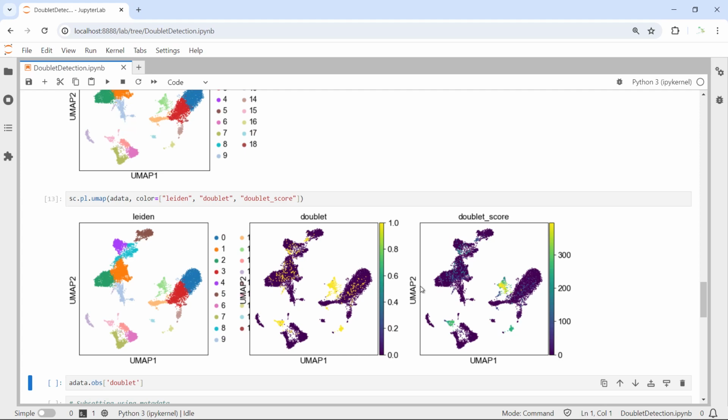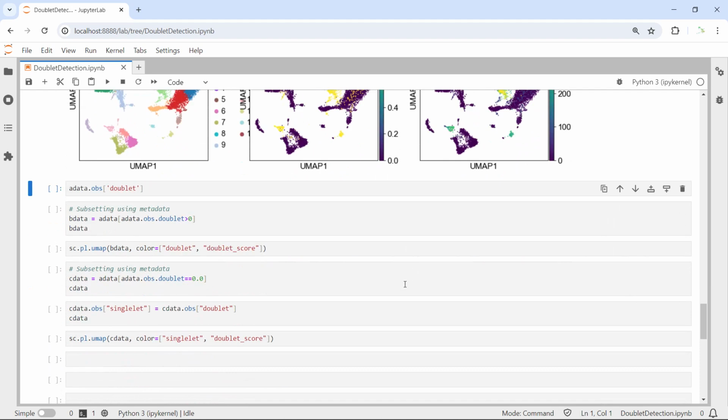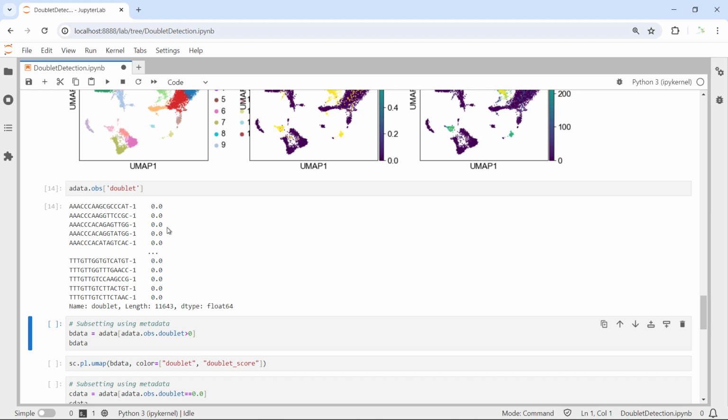So now we label the doublet, we can remove the doublet from the data. I showed you we have the doublet information in the A data observations. We can have a look at the doublet information. You can see the cells that labeled as 0 are singlet. If the number bigger than 0, they are doublet. So we can subset the data using the metadata. If we set the doublet bigger than 0, we will get all the doublet.